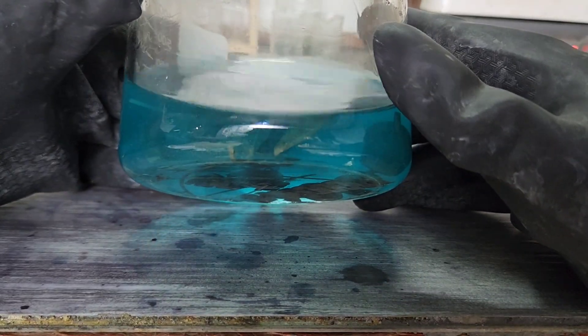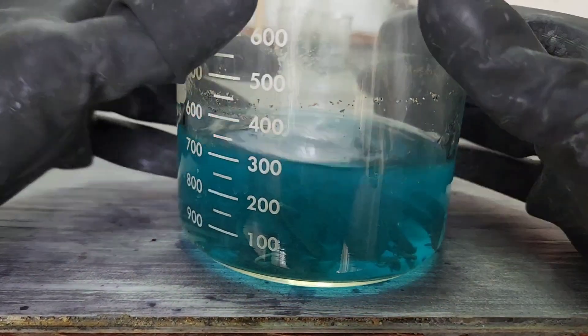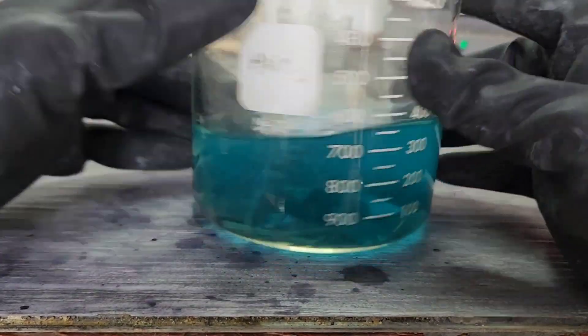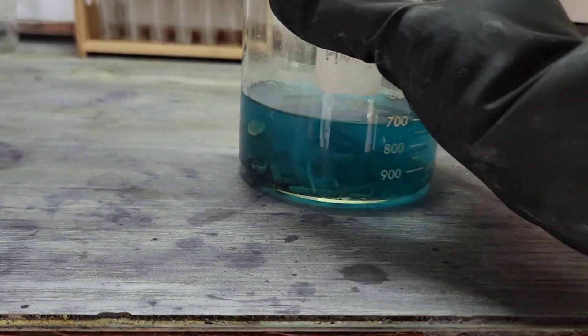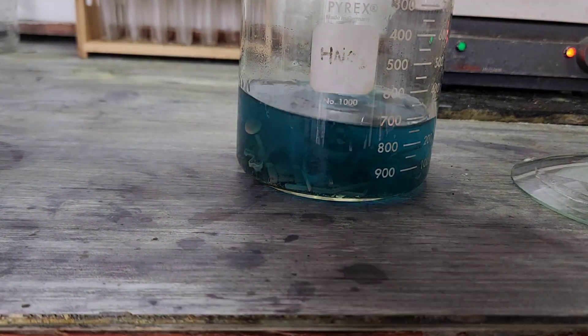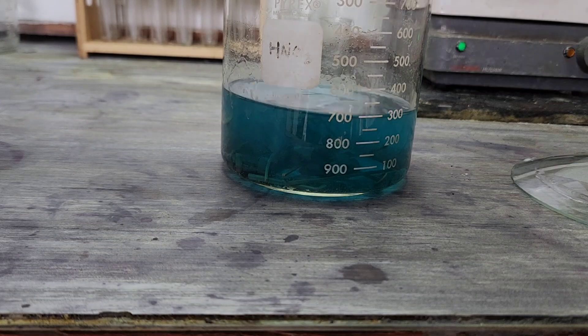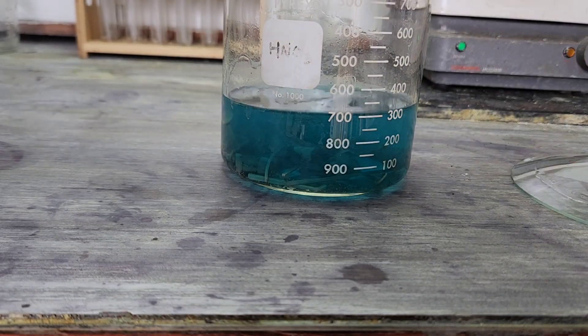All right, well we could see we've got tons of material left. I probably should have turned that into shot, but ah, let's have fun with it. Oh man, that's gonna be the pun of the video. All right, well we've got 300 mils, so we lost about 100 mils due to evaporation.